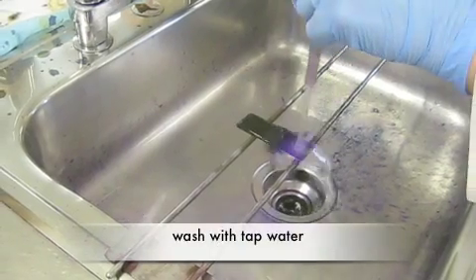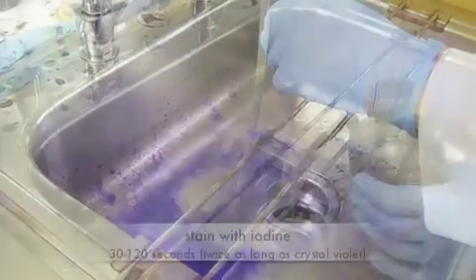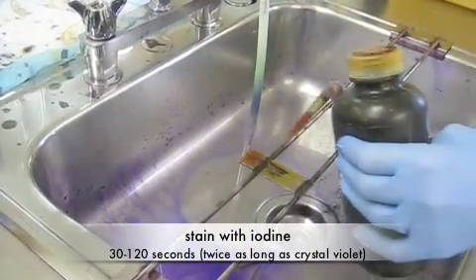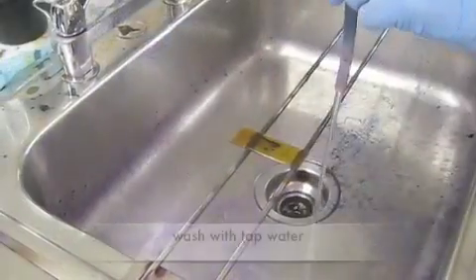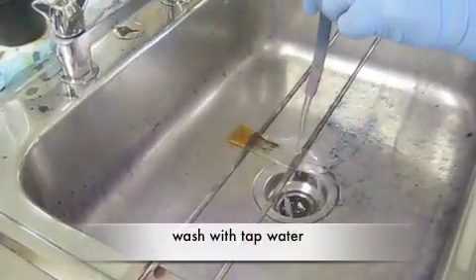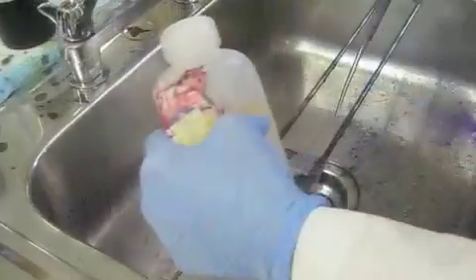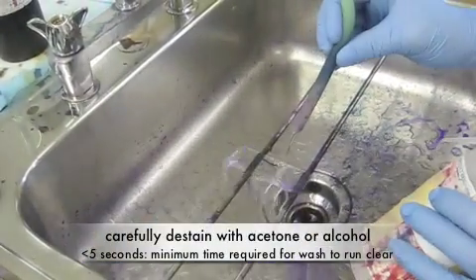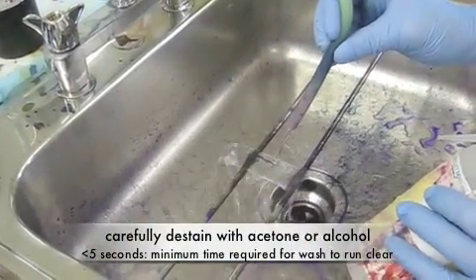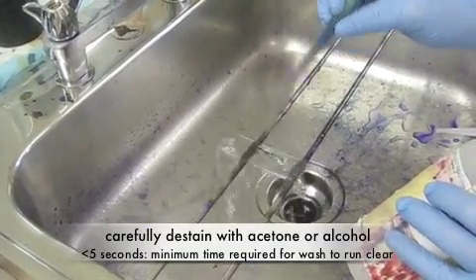Gently wash the slide, and stain with iodine next to trap the crystal violet in the cell wall. Wash again, then decolorize the slide with alcohol or acetone to wash away the crystal violet from gram-negative bacteria.